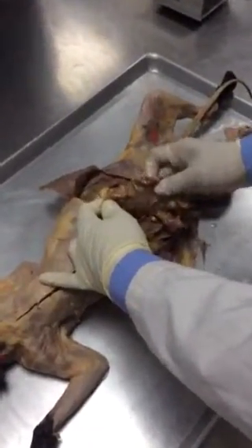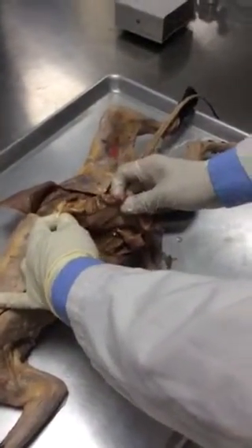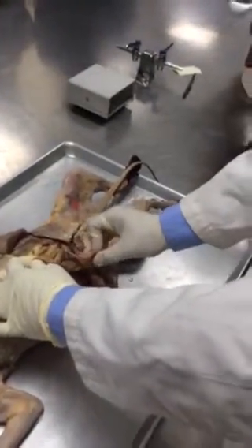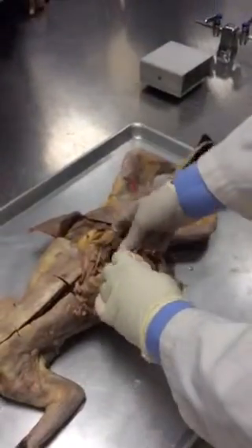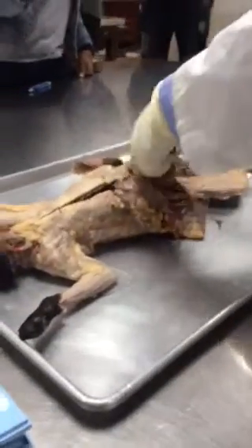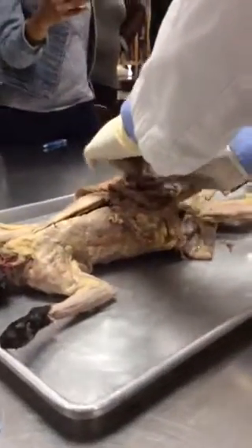What is this membrane called? This membrane? You see the membrane? You can see through, right? What is this called? It connects the intestine from the posterior abdominal wall. So right here you see posterior abdominal wall. It is connecting and fanning out. So you see the mesentery, right? This is the mesentery. Don't forget, all right?